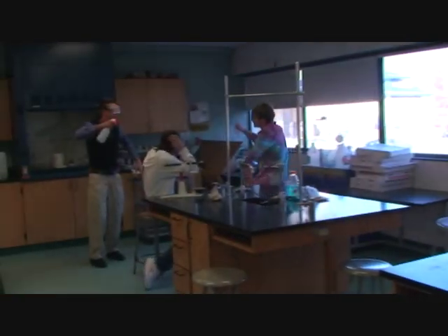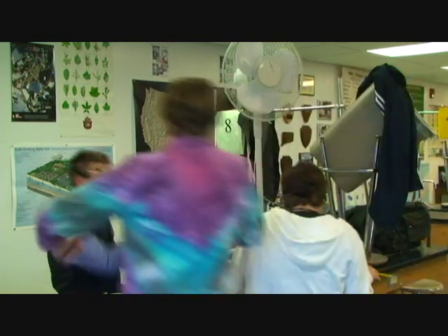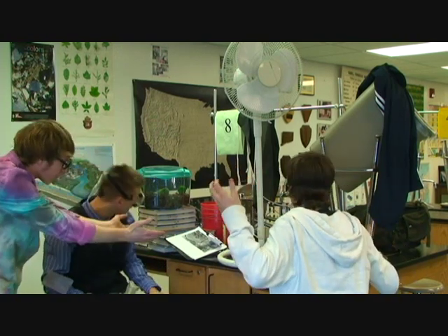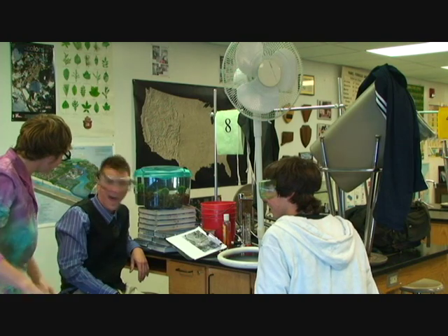Jamal, what did you do this time? There is no sneak attacks in the lab. That is horseplay. Jamal, Ralph, what are you guys trying to do? Look at all the clutter on your desk. How can you perform an experiment with all the clutter on your desk?